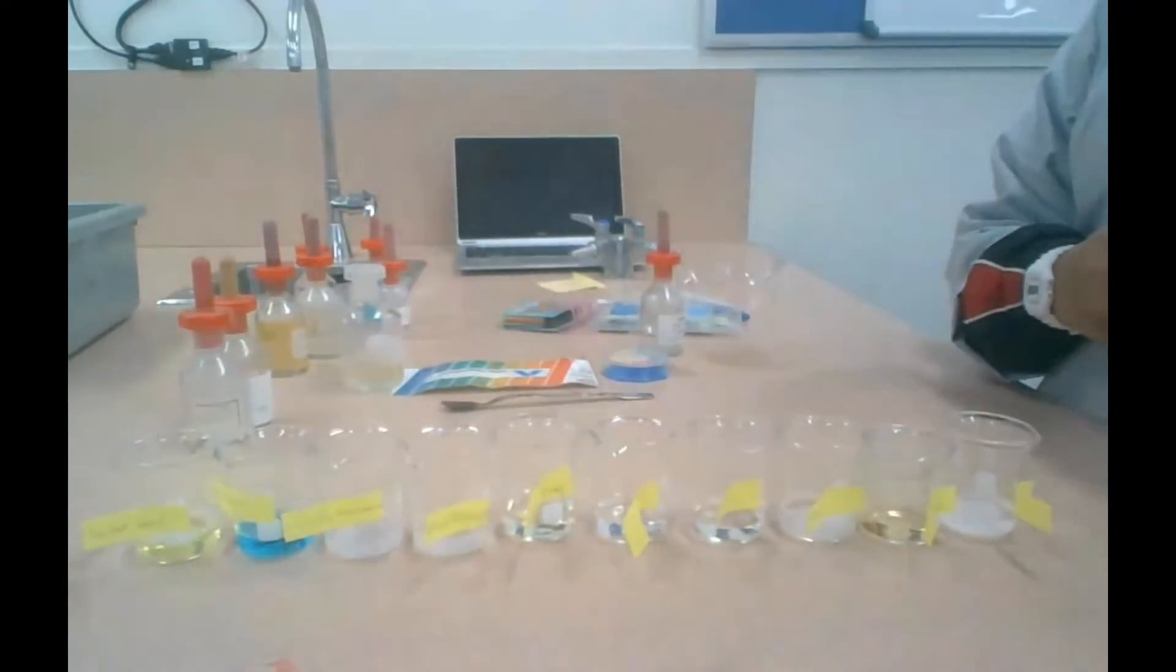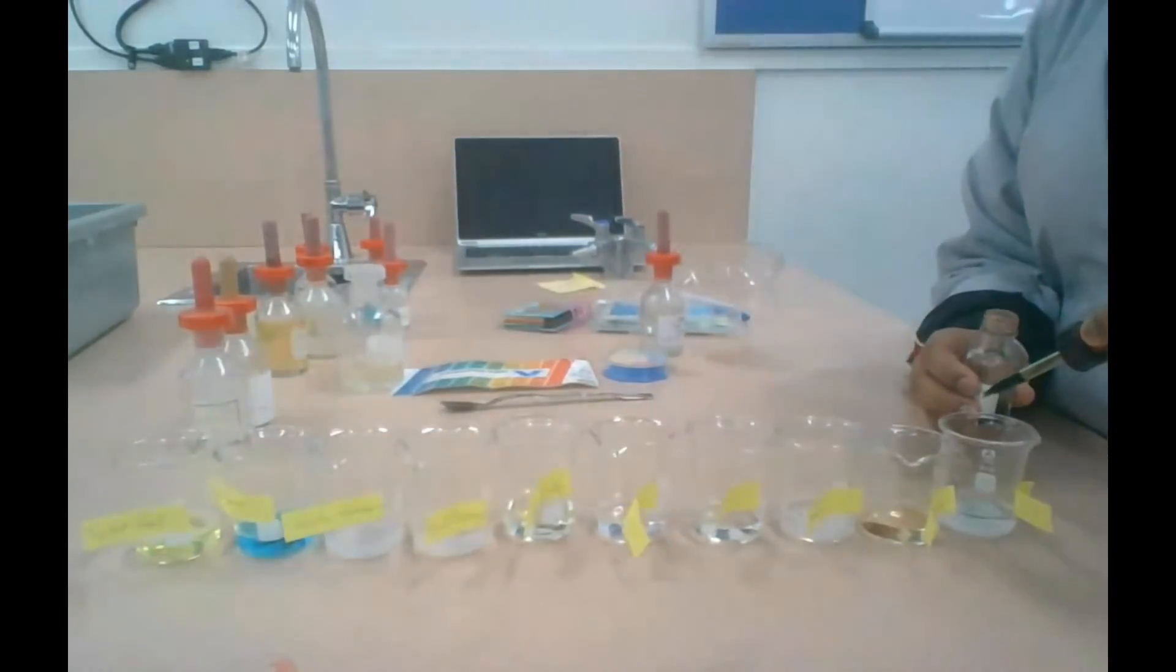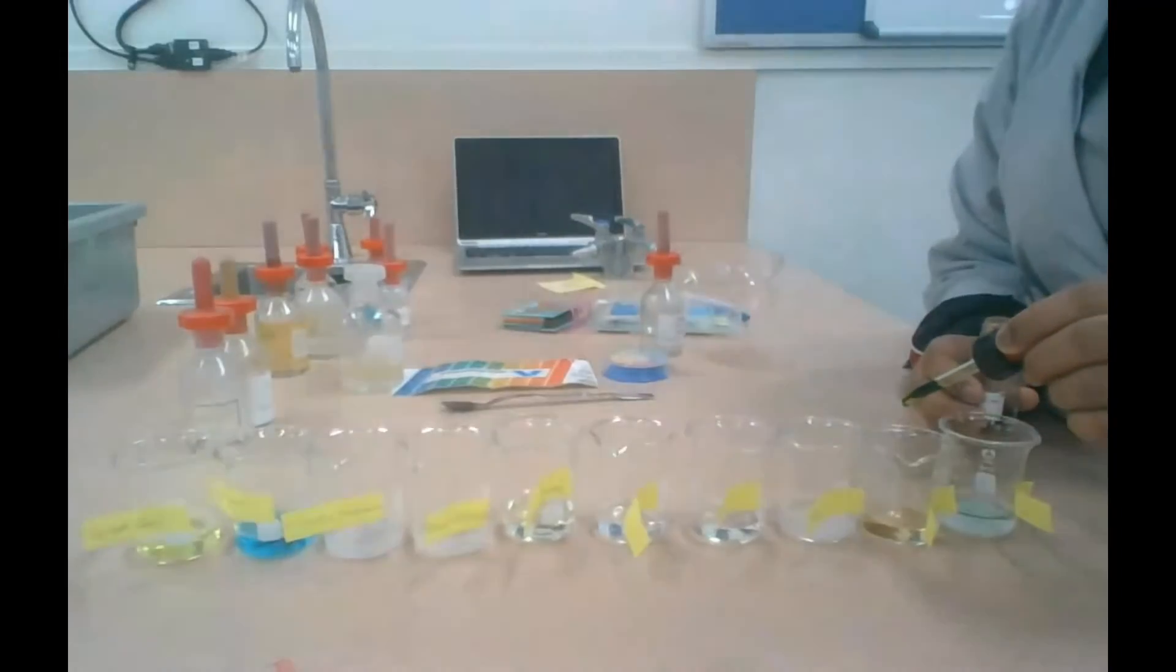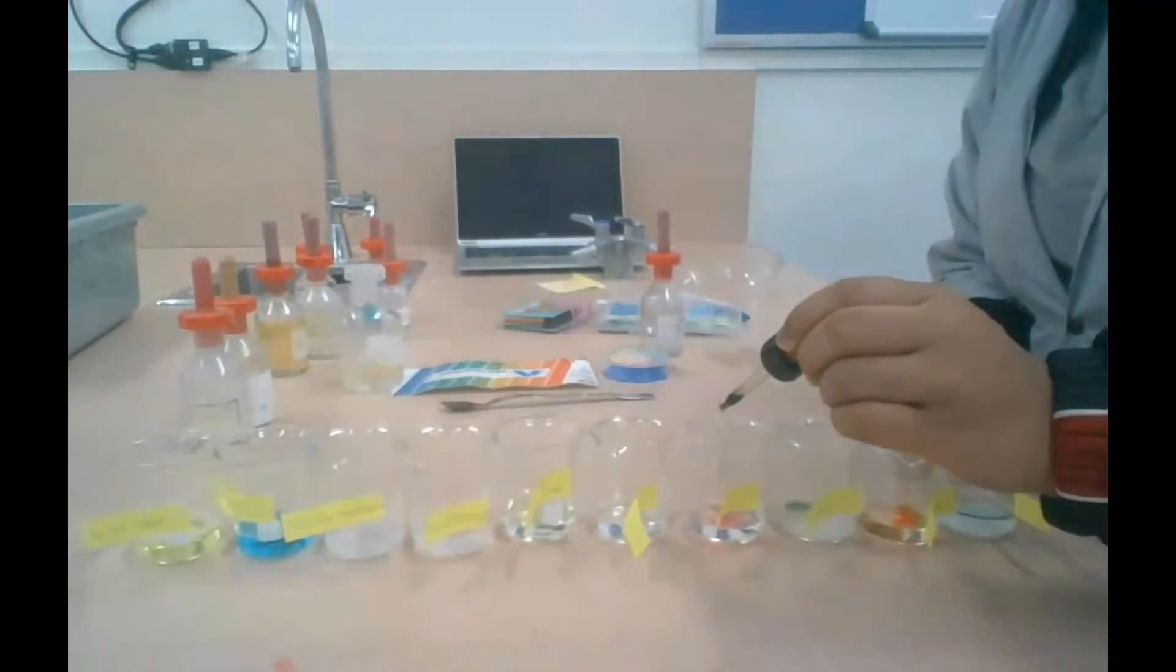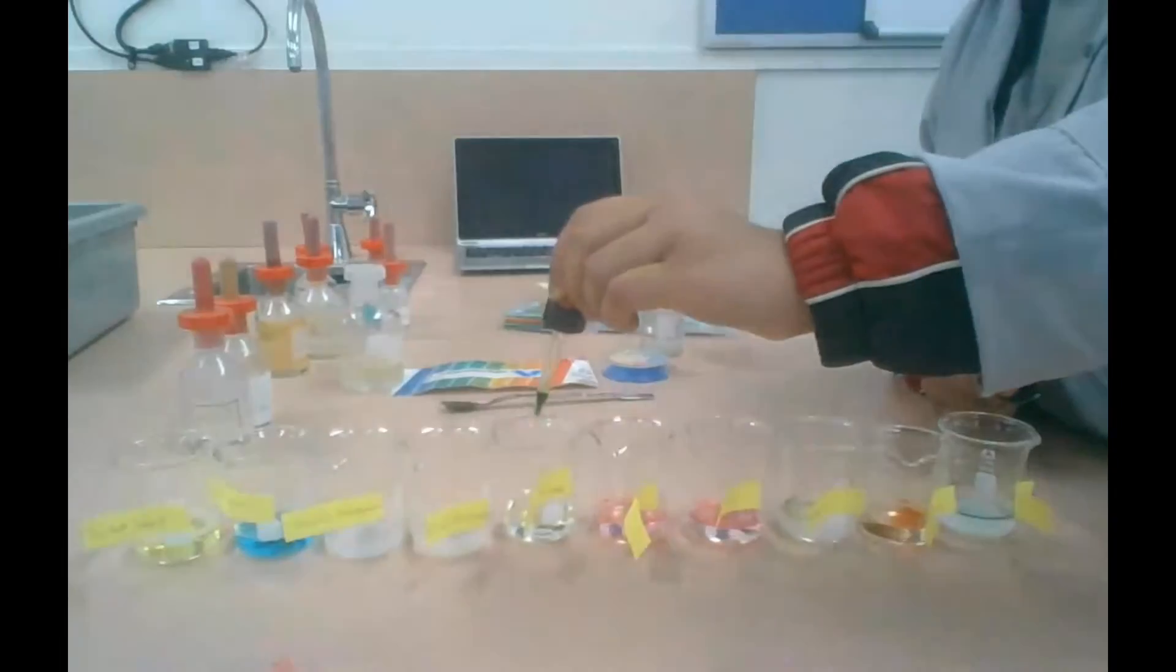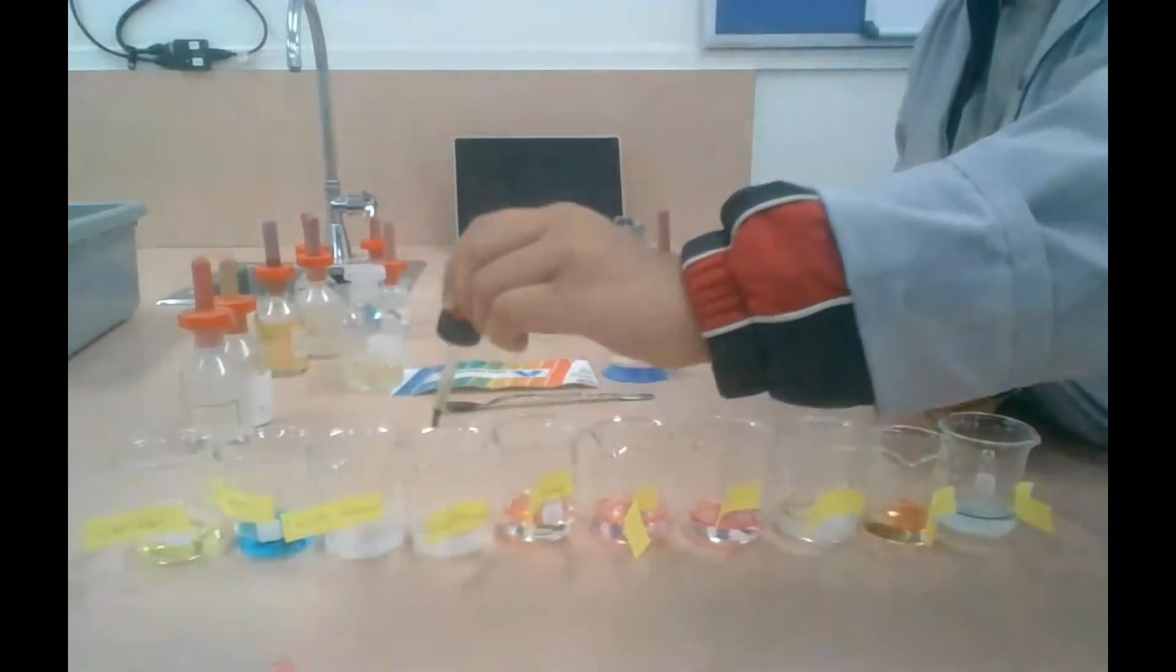You can see here now that I'm putting the universal indicator in each of the beakers. Watch what happens when the indicator meets the solution. You can see that the colors are slowly beginning to change.